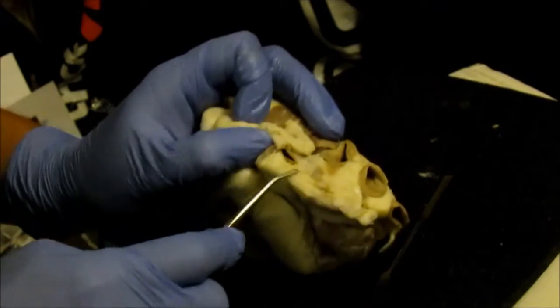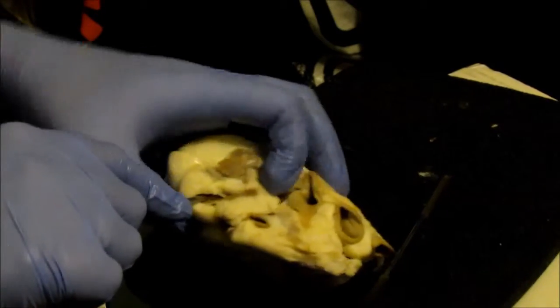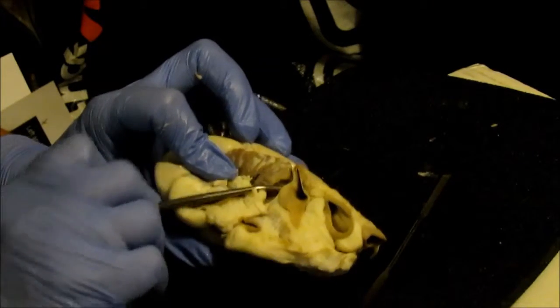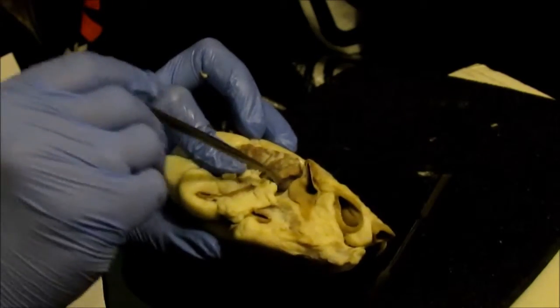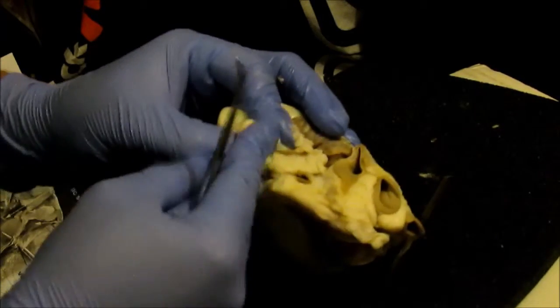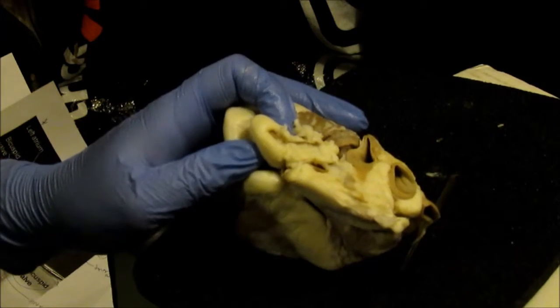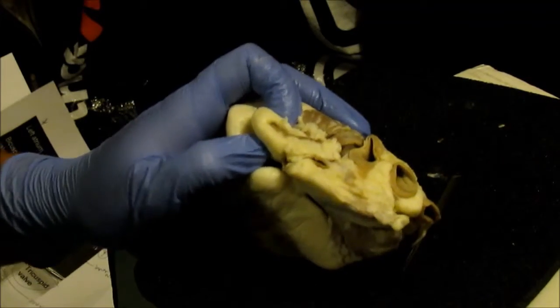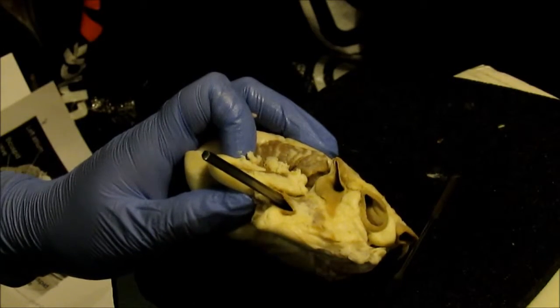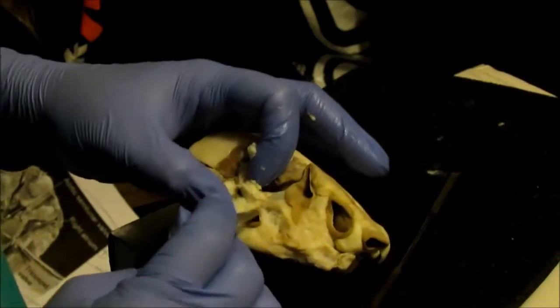The ascending aorta would be going down this way, and you can't see it, but it'd be like an arch going down in there. It'd be ascending, and then the descending going down. I believe this might be part of the arch there. We cut it. There's three major vessels in the aortic arch, and that's the brachiocephalic, so that would be that one. The left common carotid and the left subclavian, which I believe were cut off. I cannot see them unless they're underneath all this.